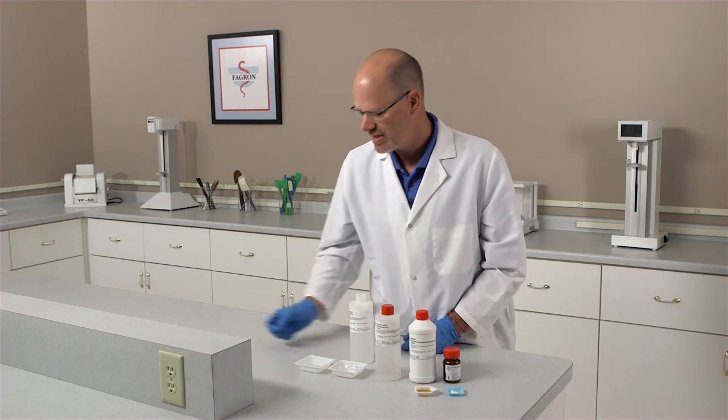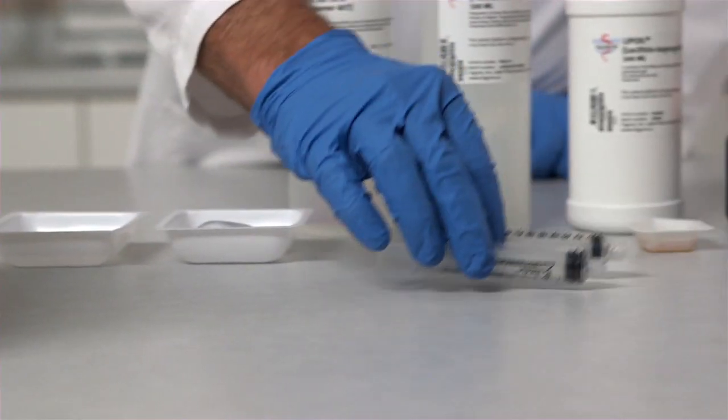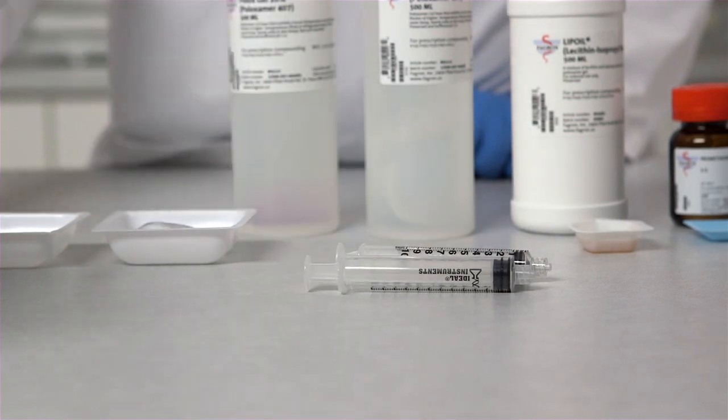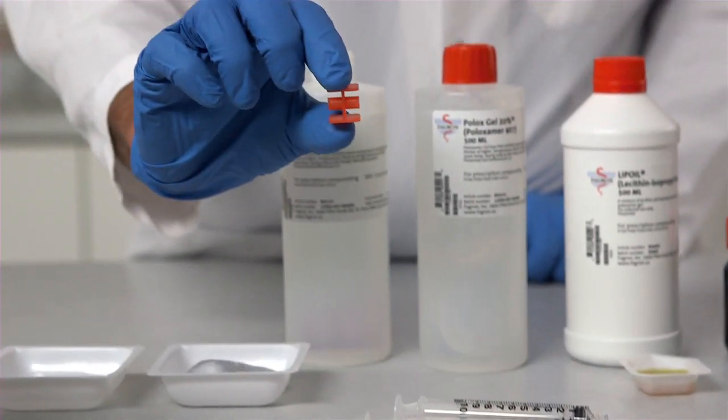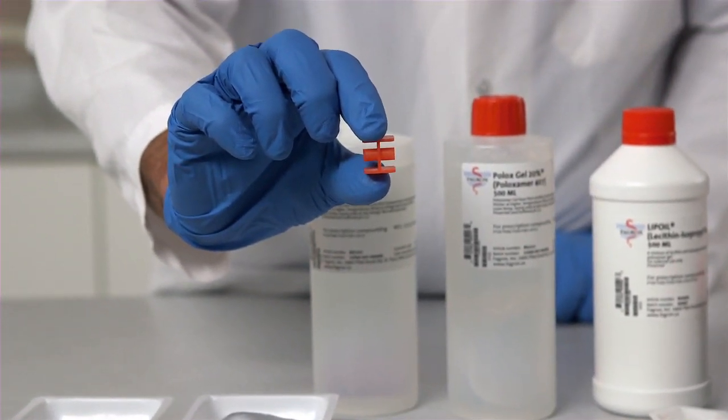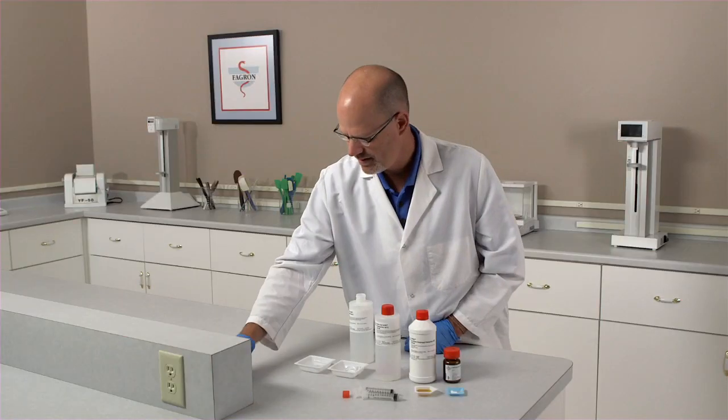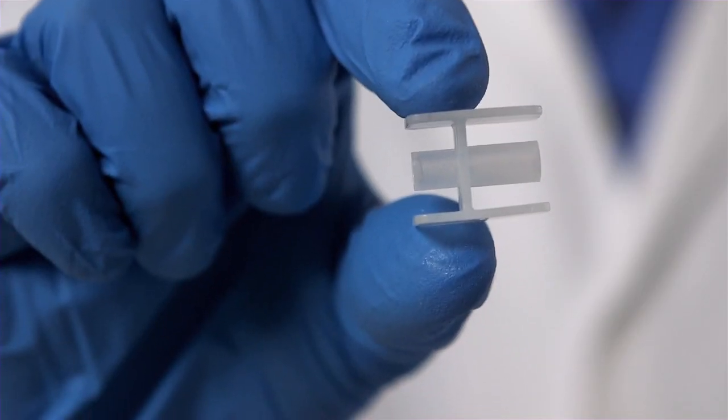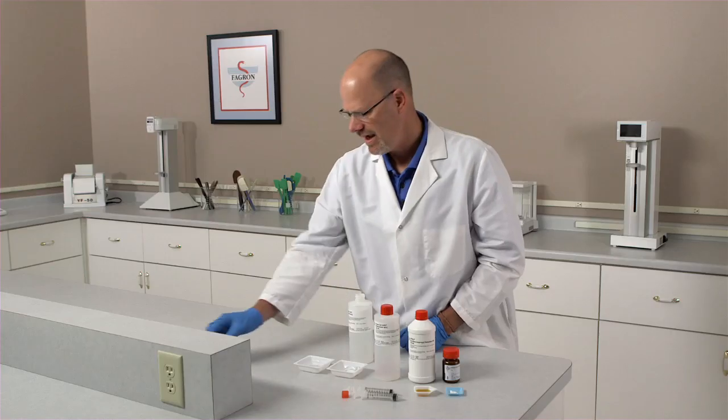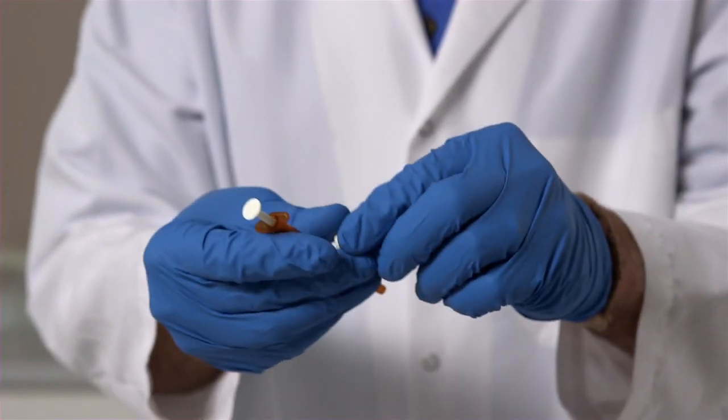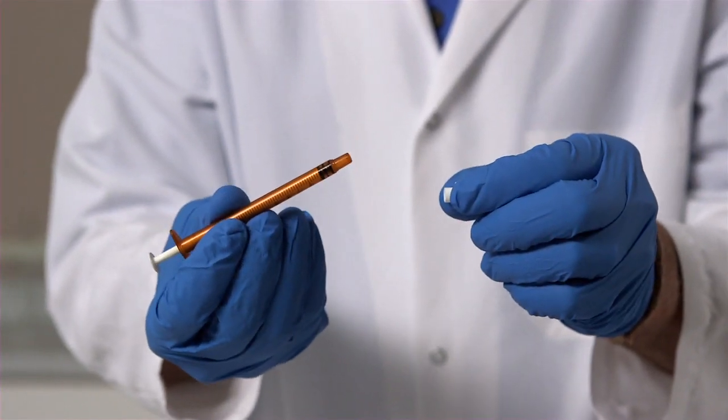The other components that we'll be using are two luer lock syringes, 10 ml, a red luer-to-luer connector, a clear luer-to-oral connector, and one oral amber syringe with a cap.